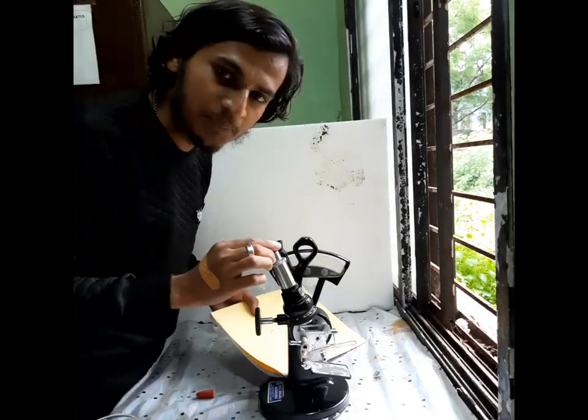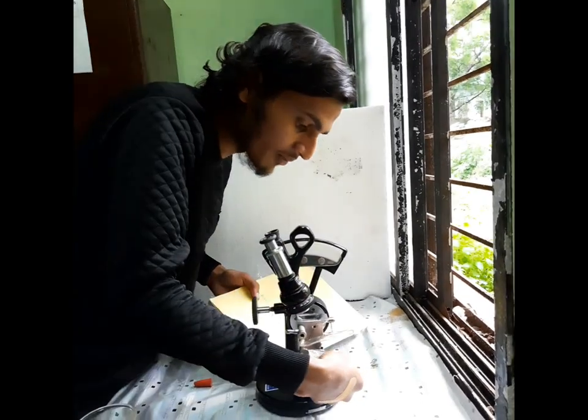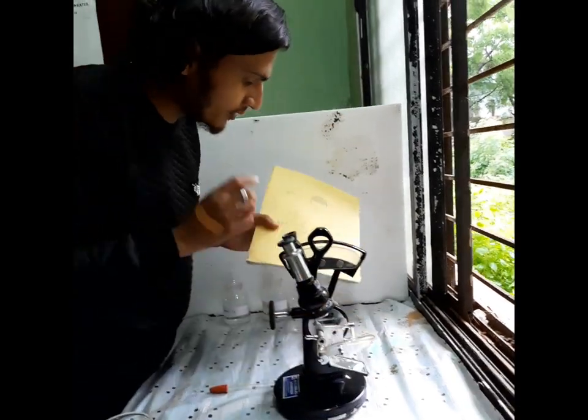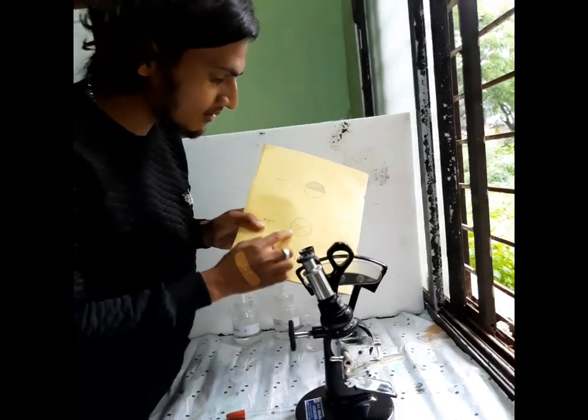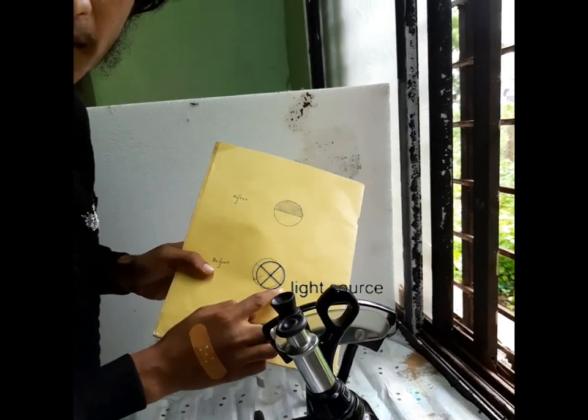In this eyepiece, after adjustment of the lighting, we should get this structure — nothing but the X-Y crosshair structure.